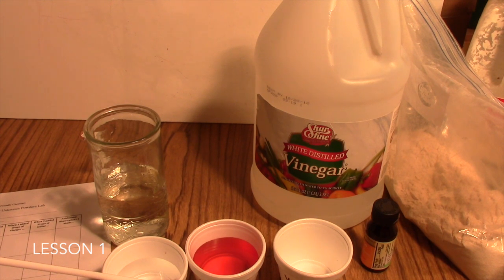An extension to this is to have a powder ready for your students to take home with them. You can take one of the powders that you used in the lab. You can put together a mixture of powders. A fun challenge powder to send home that I've done in the past is a cake mix powder. You just buy a cake mix, or even instant puddings, which will have a combination of starches in them. They'll have flavorings and stuff in them. Some of those are kind of distractors, which make it even more interesting for your students.